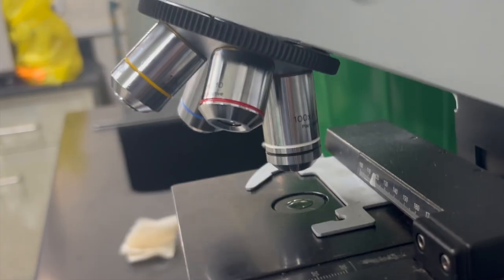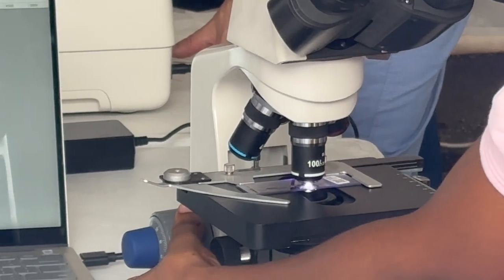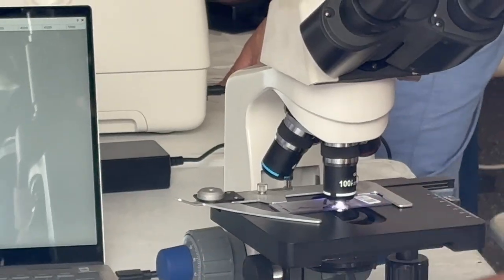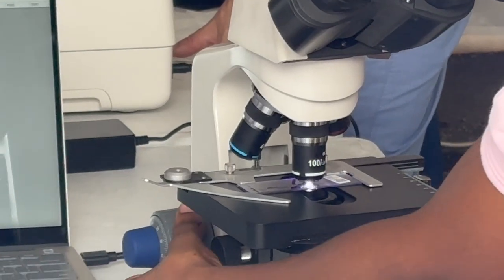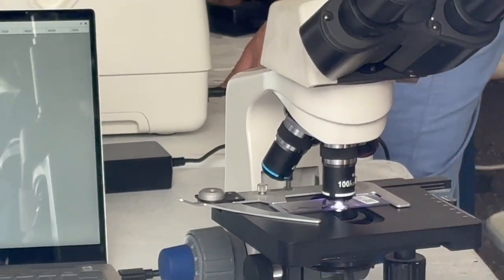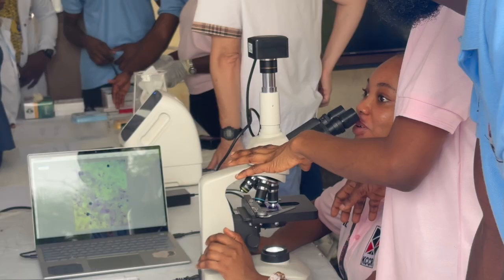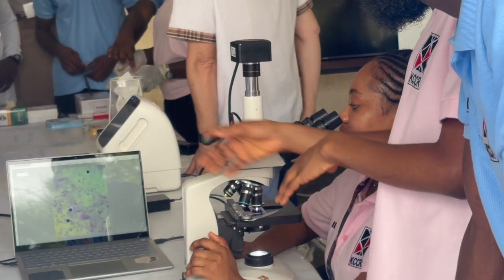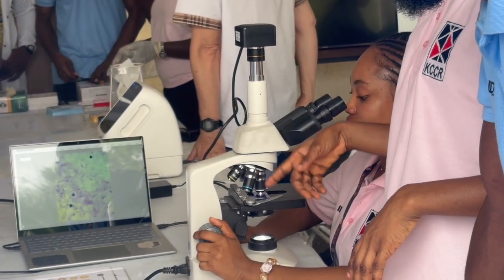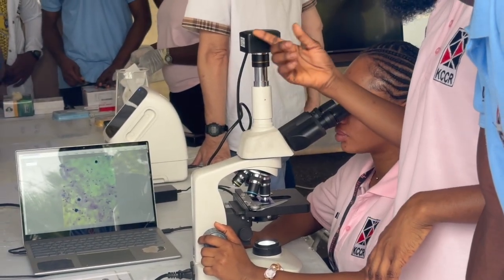Or if you're viewing specimens like tissue culture specimens, then you can go ahead and place that flask or petri dish. It's generally a good idea to have the stage as low as possible so your specimen is not too close to the objectives. You would want to start off with your 10x objective. Use the clips if you're looking at a slide to hold it in place. And once it's in place, you'll be able to move it from the sides, backwards. You can also go from forward and side to side.